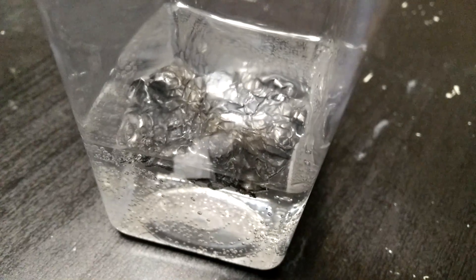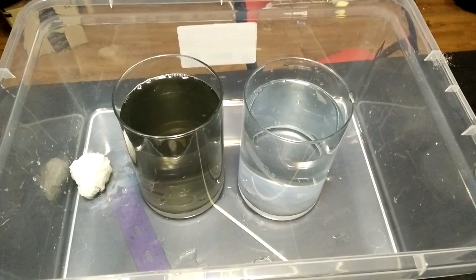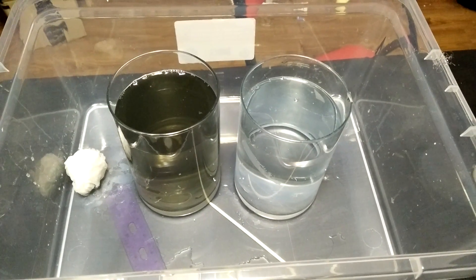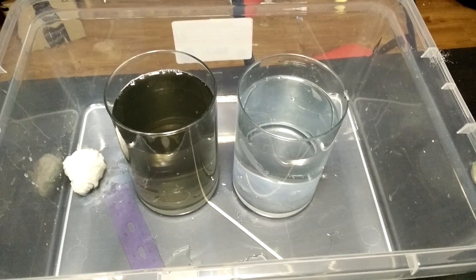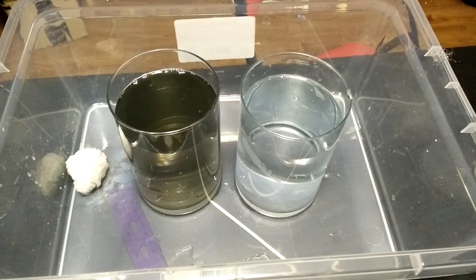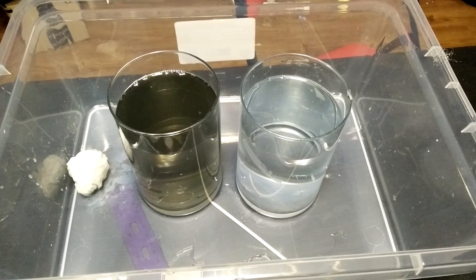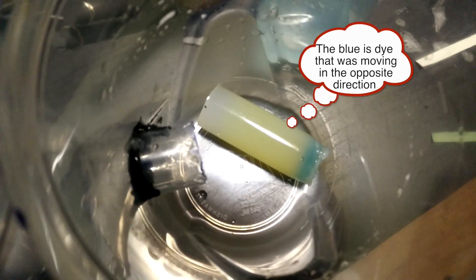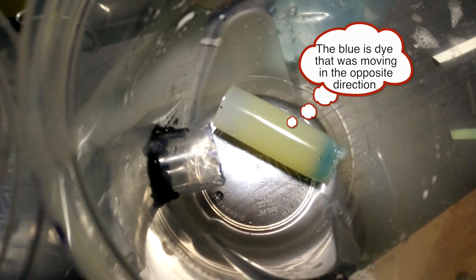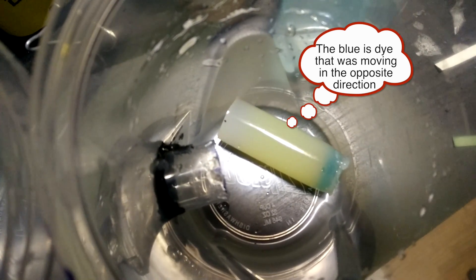After 10 minutes the aluminum had actually started to darken. If you wanted to improve this or make it more concentrated you would have to boil off the water, but if you're going to do this do it in a steel container since it would eat through glass. You can also use the solution as is or leave the cell running longer if you want it more concentrated. However if you do concentrate it further the agar will start to shrink and the gel gets messed up at the incredibly high pH, so you'll want to stop before it's destroyed and the two chambers of liquid mix.